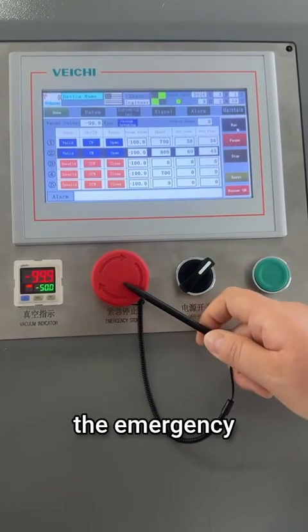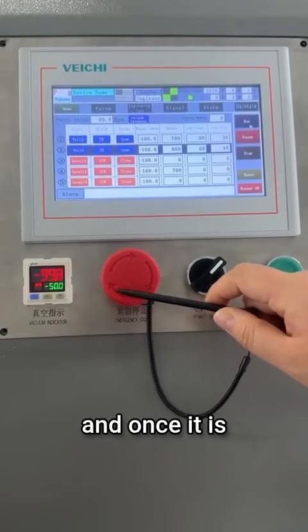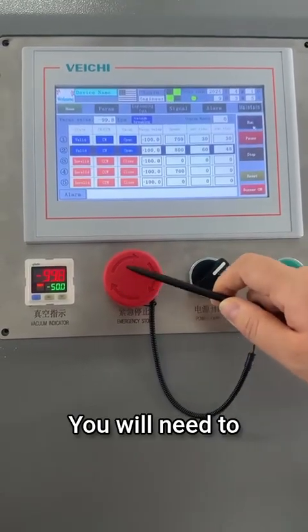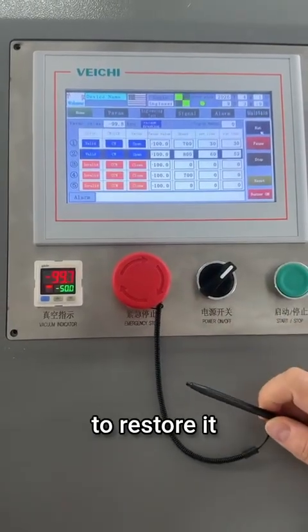We can also use the emergency stop button. So in an emergency, press the emergency stop, and once it is pressed down, you will need to reset it by rotating it counterclockwise to restore it.